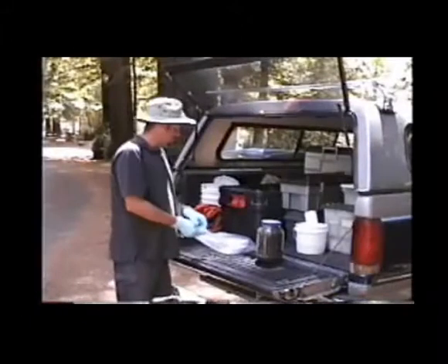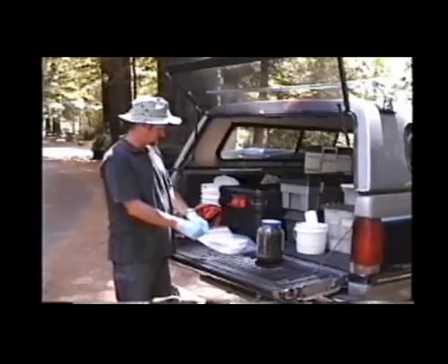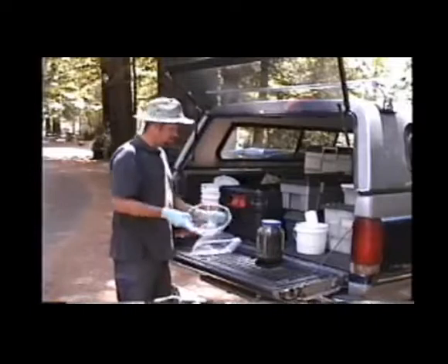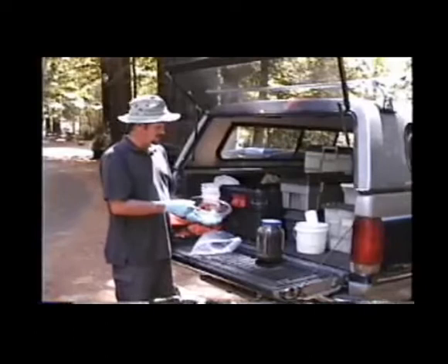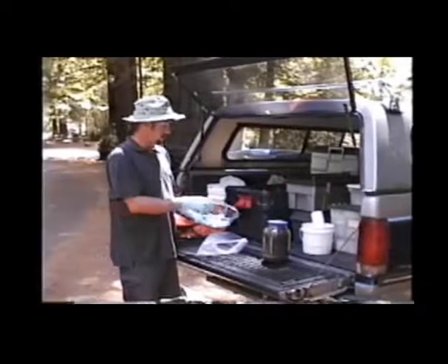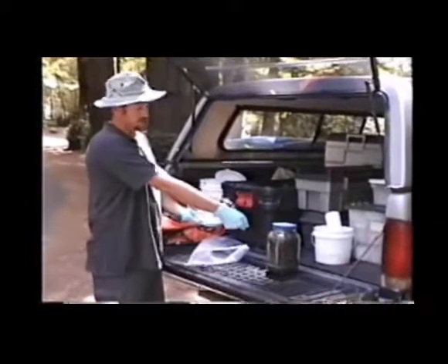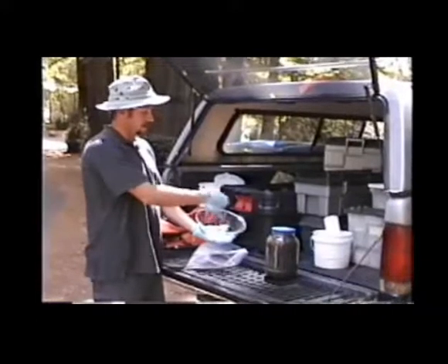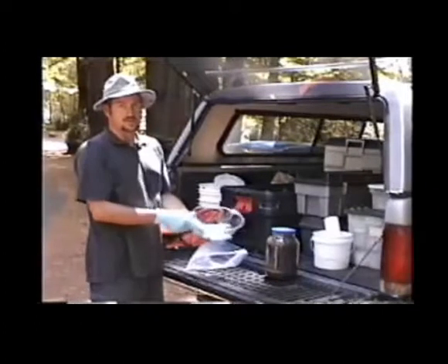Another form of sediment homogenization and aliquoting that you can use is a glass bowl. This can help with homogenization a little, and aliquoting. It can make things a little easier. You don't have the smaller hole of the jug to scoop out of to aliquot into smaller jars, so you can stir and scoop and aliquot a lot easier from the bowl to smaller jars.